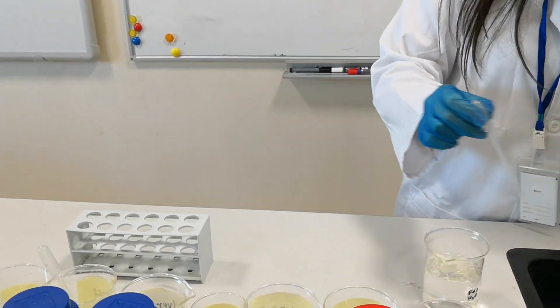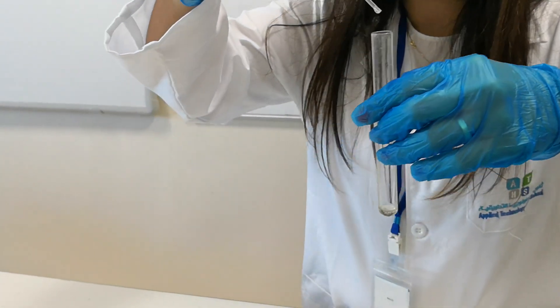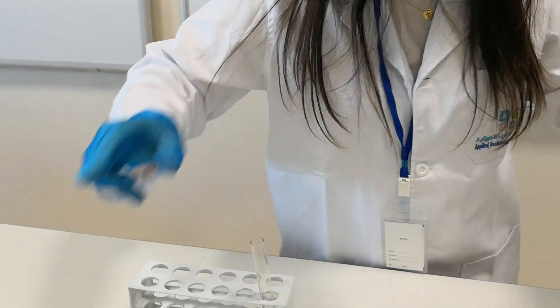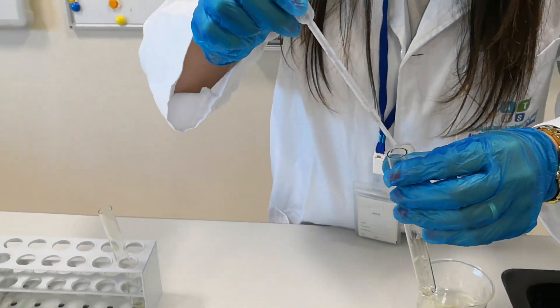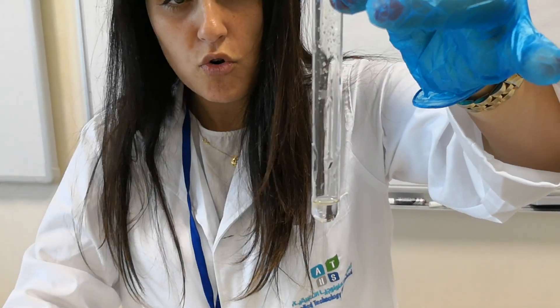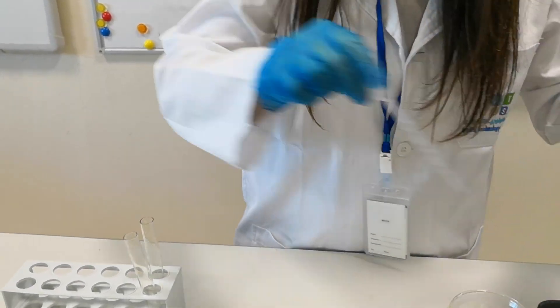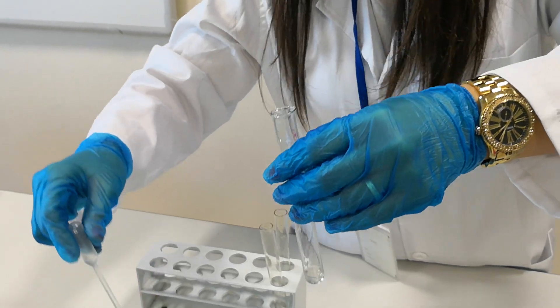First, let us begin with the lithium cation. Adding drops of sodium hydroxide — nothing will happen. Now let's try potassium. This is a sample containing potassium ions; we add drops of sodium hydroxide — no precipitate. Now we will try the sodium cation. With the hydroxide solution — again no precipitate.